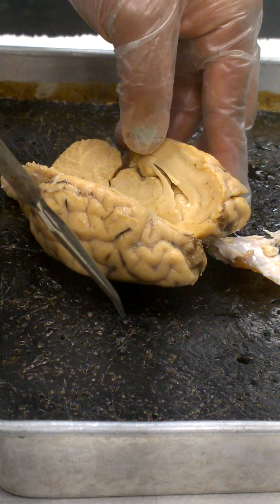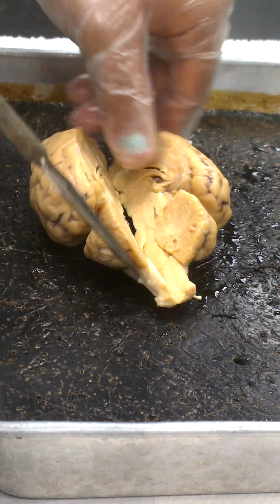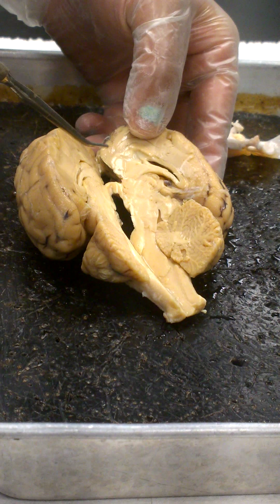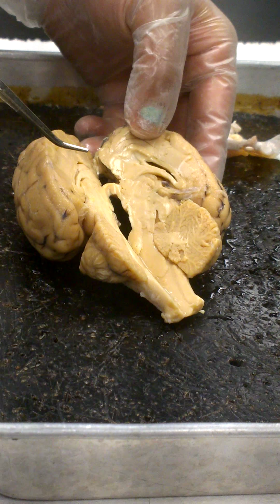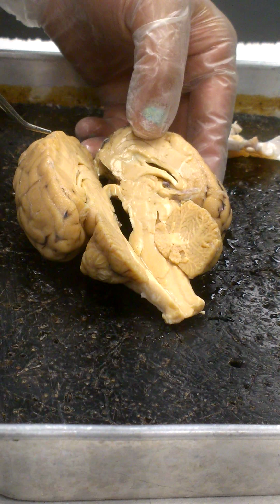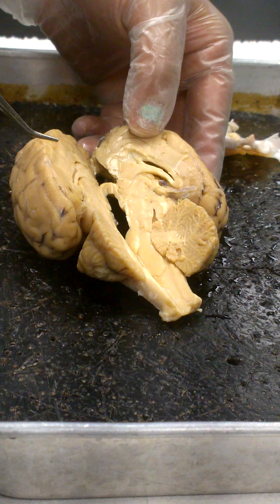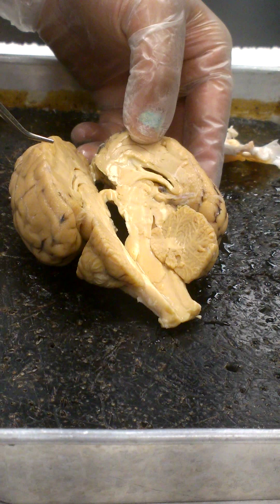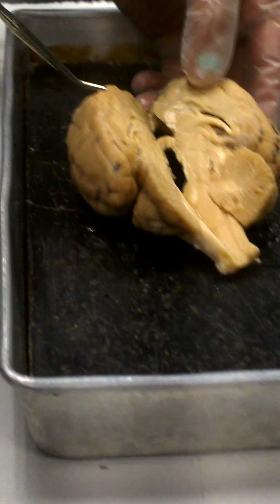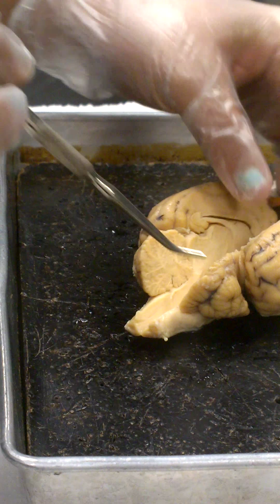Okay. This on top, guys, is your corpus callosum. She's trying to separate in that space. That's your lateral ventricle in there. Okay. This bottom one underneath the lateral ventricle, that's your fornix. So the corpus callosum's on the top, then your fornix, and your lateral ventricle is the space she's trying to get into. You can see the fornix coming down this direction. Off the back end, the corpus callosum comes up and around, and the fornix comes downward.